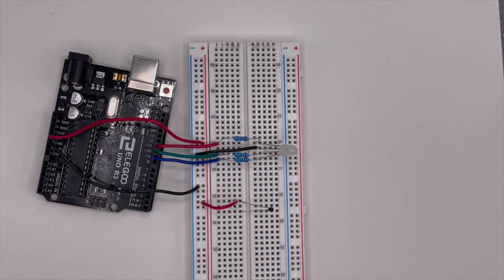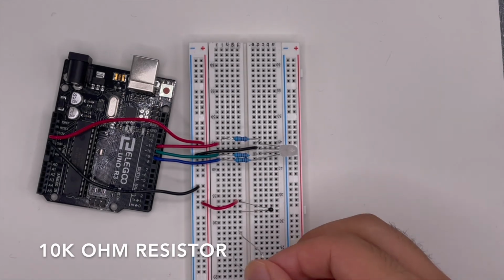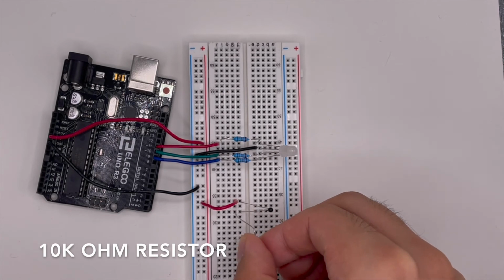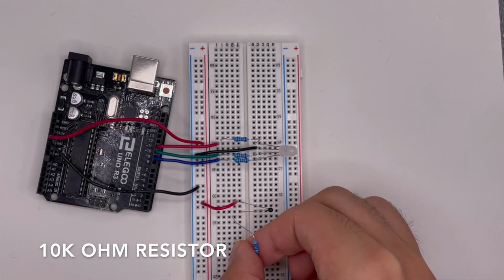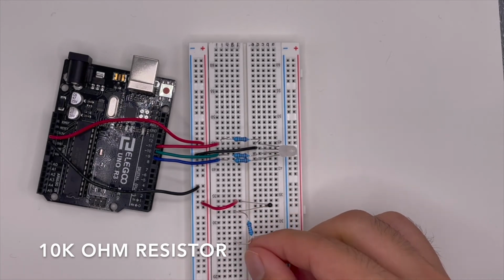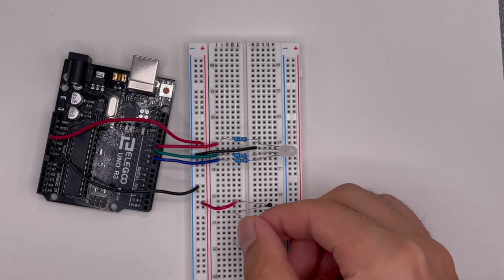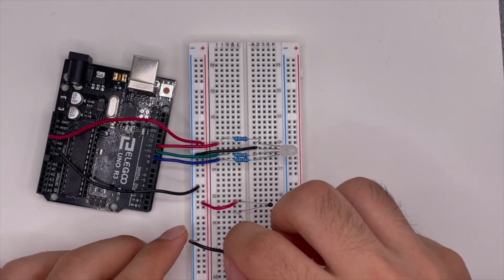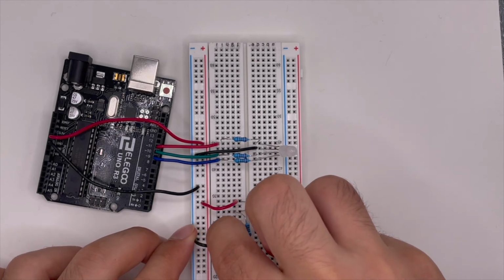Before we connect it back to ground, we will also put a resistor in between so we can have current flow through it. Make sure to put the two legs of the resistor, one in a separate lane and the other in the same lane, sharing with the temperature sensor. After that, we can connect our ground pin from the resistor there to the negative bus lane.